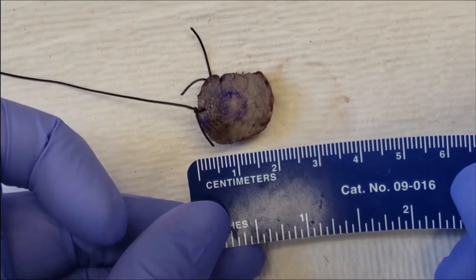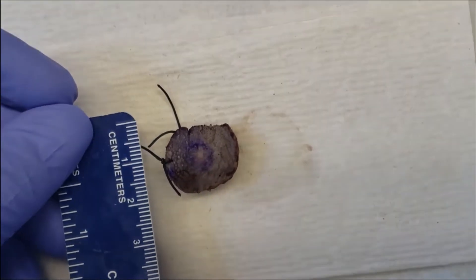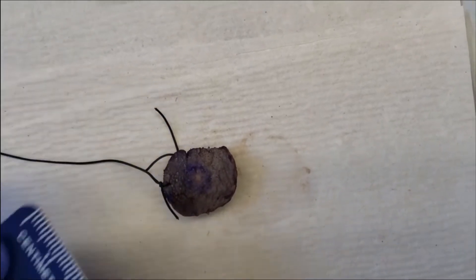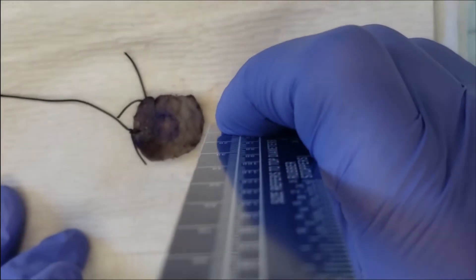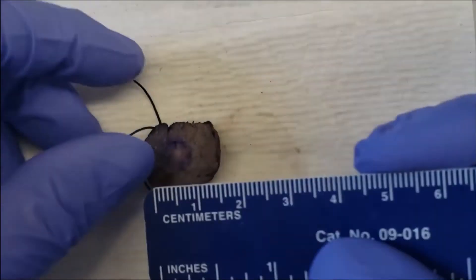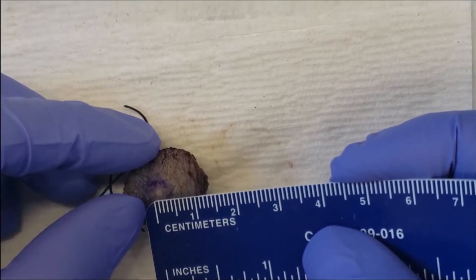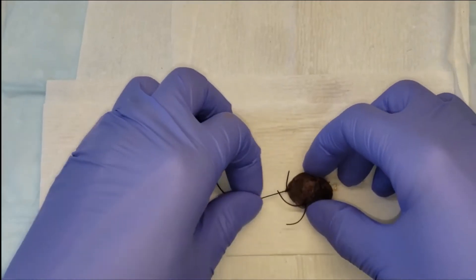Here you can see our surgical specimen and we're going to measure it in three dimensions: length, width, and height. The side that is facing up is the epithelial side, the surface side, and that blue circle represents the surgeon's outline of the cancer. After we've measured the entire specimen, we're going to measure the area of concern — the area of cancer on that surgical specimen. This is incredibly important for our synoptic summary.